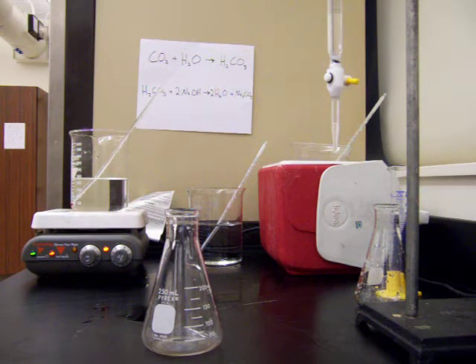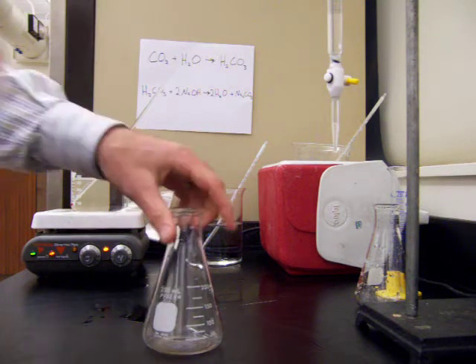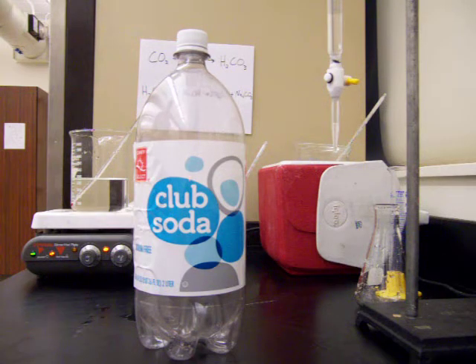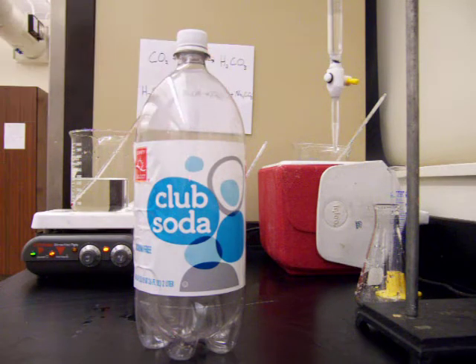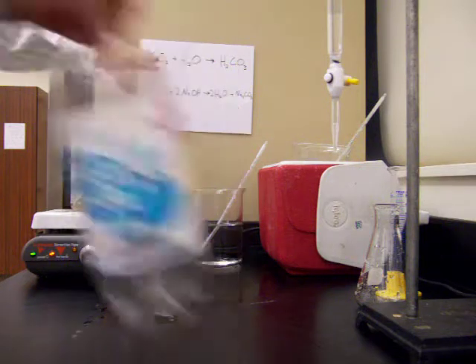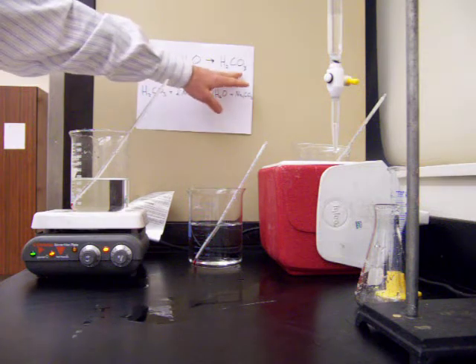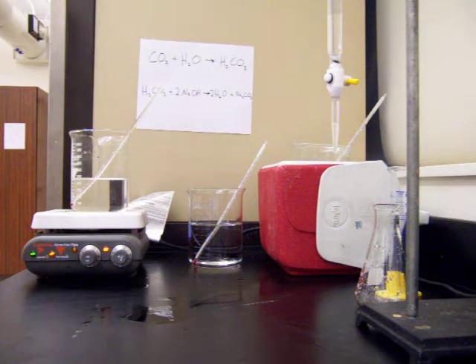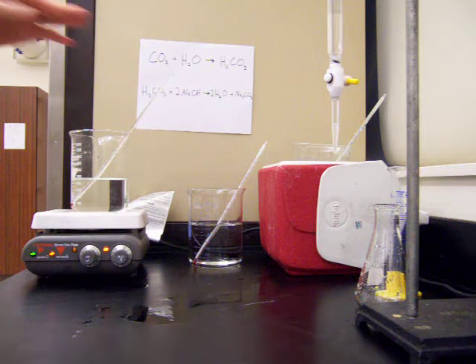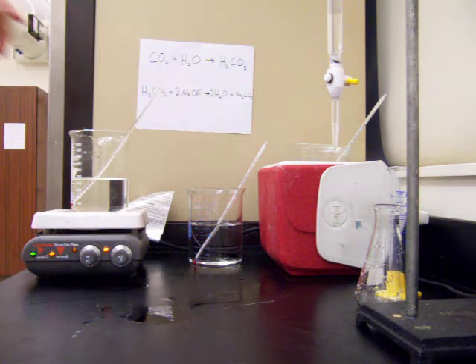This lab is the solubility curve for carbon dioxide in water. We're going to be working with carbonated water, so we just use a sample of club soda. This has carbon dioxide already dissolved in water. When carbon dioxide dissolves in water it forms carbonic acid, which will allow us to measure the concentration of carbon dioxide through a titration.